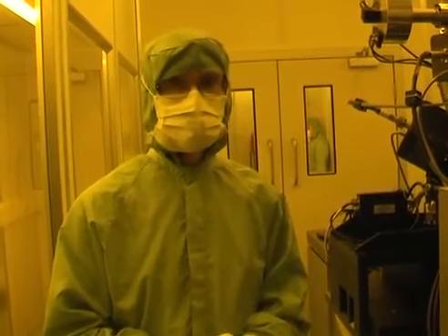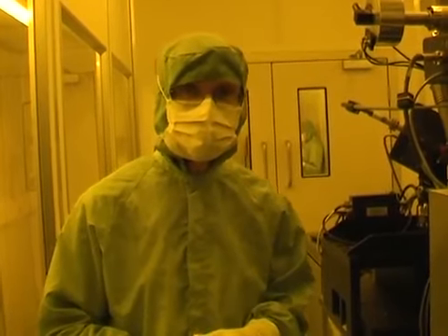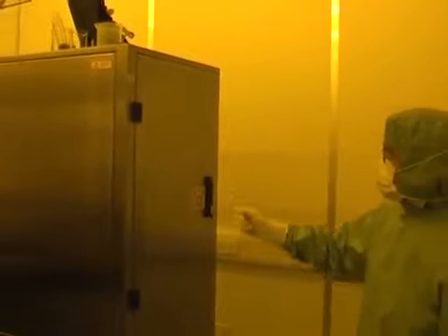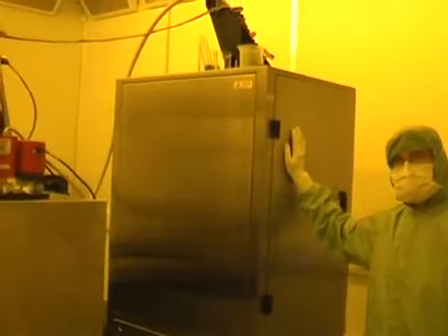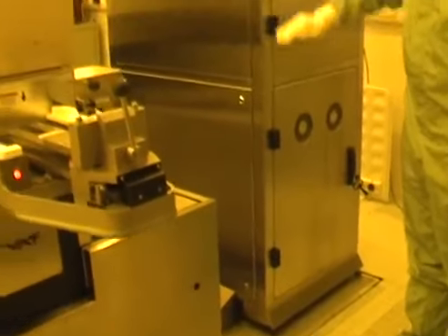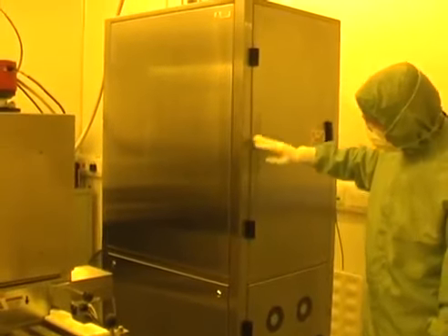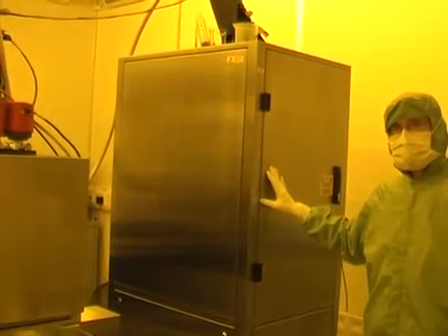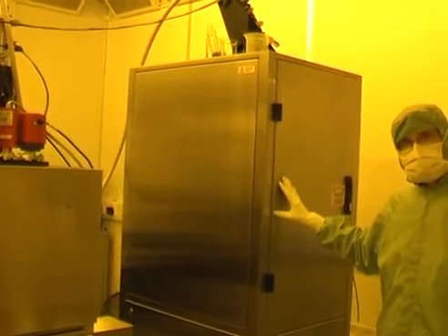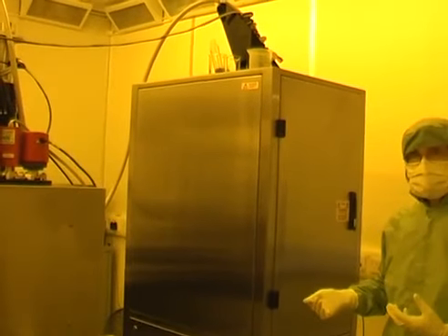I've only loaded one sample this time just to show the idea of how the process is done. While we're standing here, I can introduce you to various parts of the VB6. So what you can see here is known as a standalone EHT unit. What it consists of is a 100 kV supply at the bottom, and in the upper part of the cabinet there is floating electronics sitting at 100 kV which manages and drives the gun.